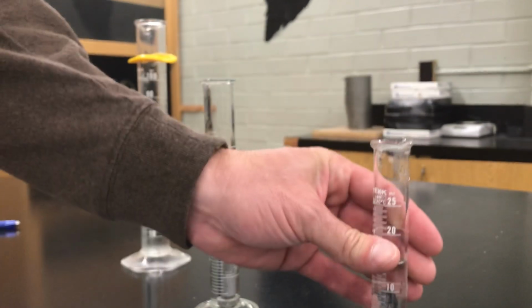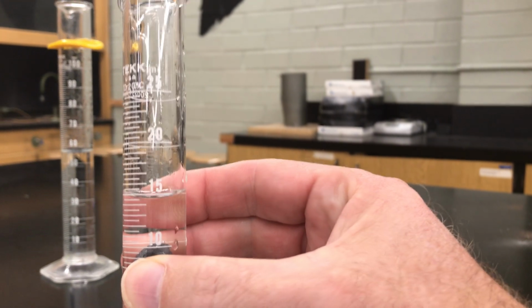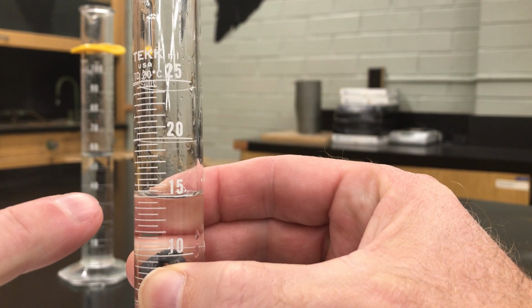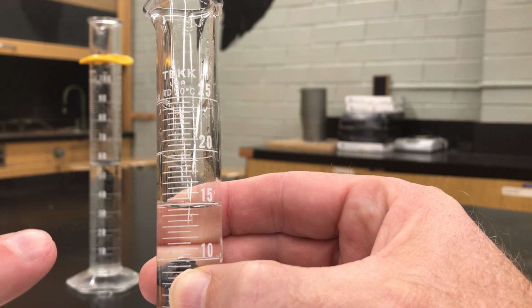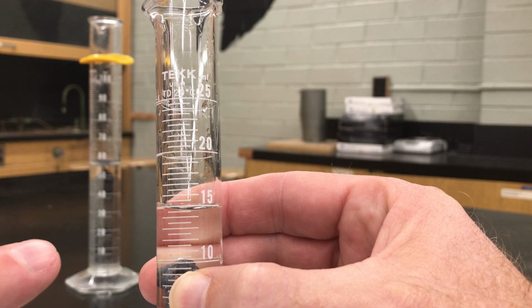Now my final volume, I'm going to drop this in and try not to break that glass cylinder. That's why he's putting it in sideways. Yep, and so it slides in, it doesn't drop in. Okay, and it looks like we're right at about 15, aren't we? Is that what you see, Mr. Radford? Well, that's even with it, so I think we're 14 and a half.